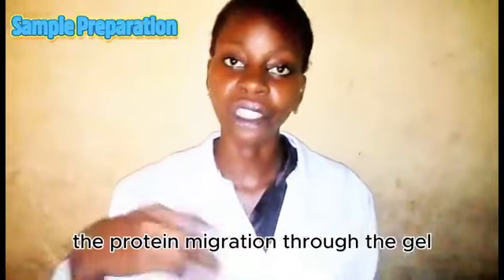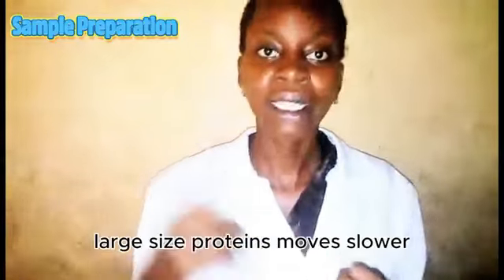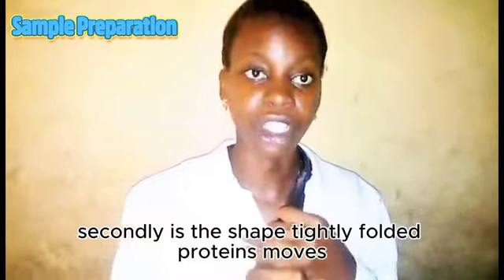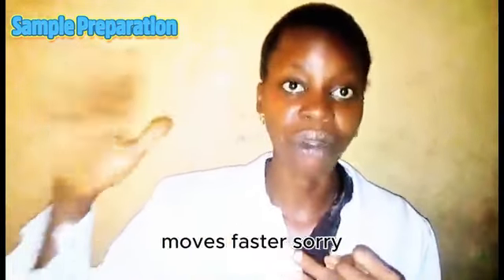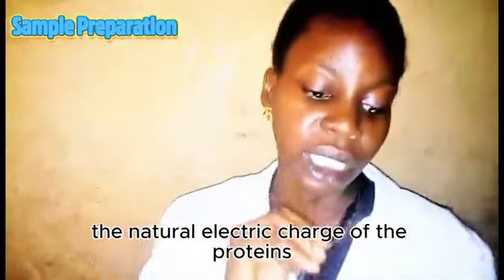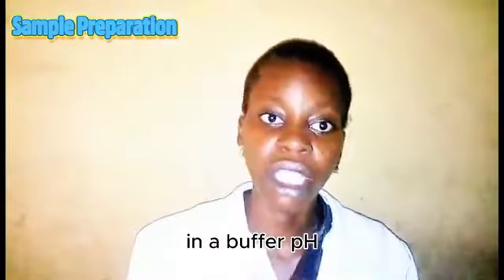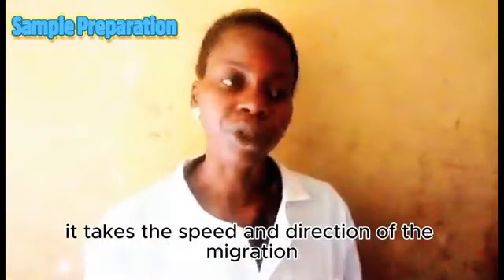Then the protein migration through the gel depends on 3 factors. Firstly is the size. Large size proteins move slower. Secondly is the shape. Tightly folded proteins move faster than the loose ones. Then thirdly is the intrinsic charge. The natural electric charge of the proteins in a buffer pH determines the speed and direction of the migration.